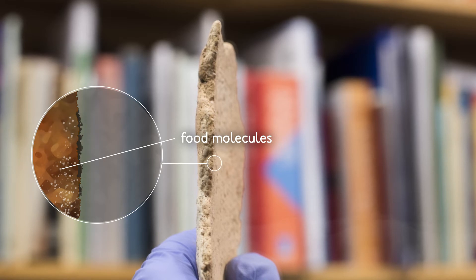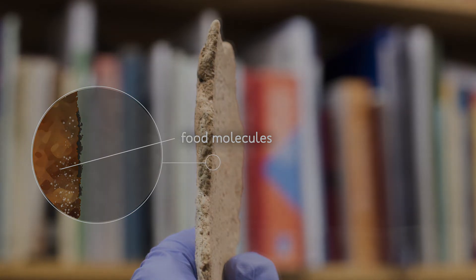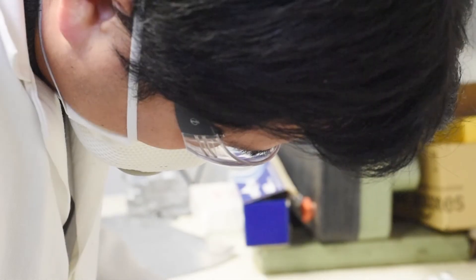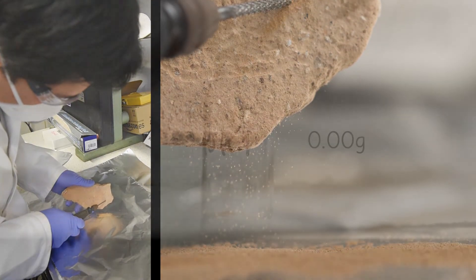It's these trace residues that we need to get to by drilling into the pot. Although the pot may look clean, we have to be sure there is no contamination. We use a clean work space and remove the surface before drilling deeper into the pot to collect the sample.